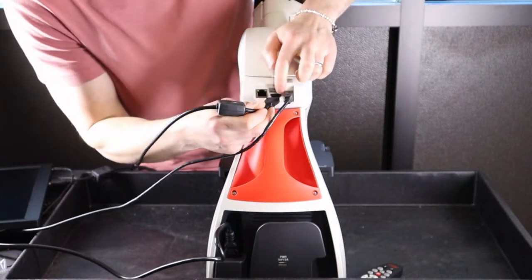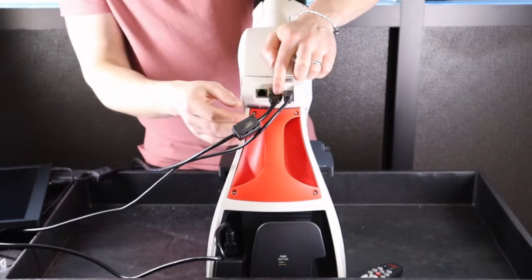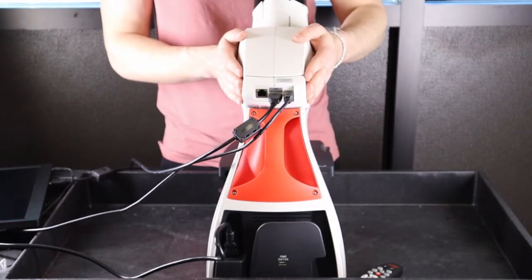Next, take your HDMI cable and insert it into the HDMI port. The other end will output to your HDMI input monitor or projector.